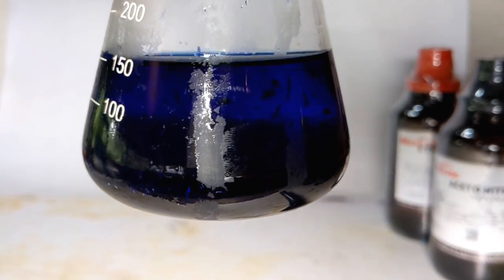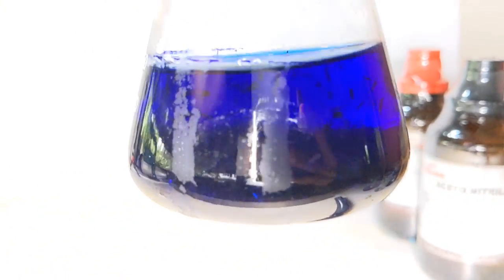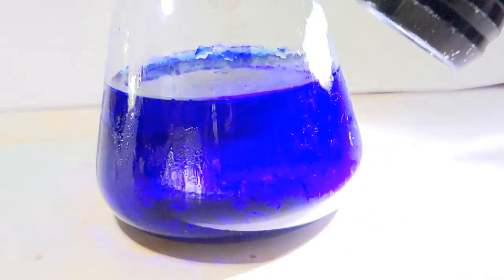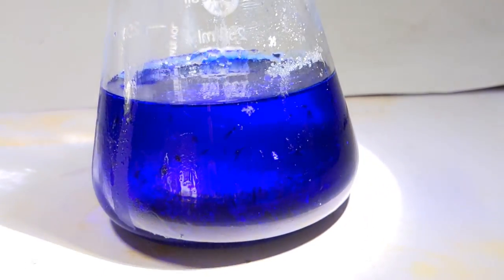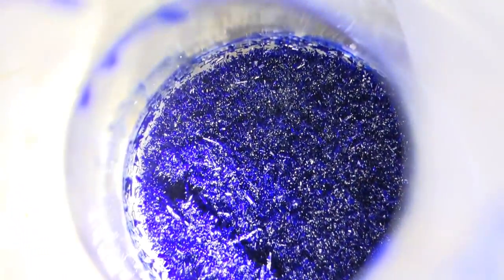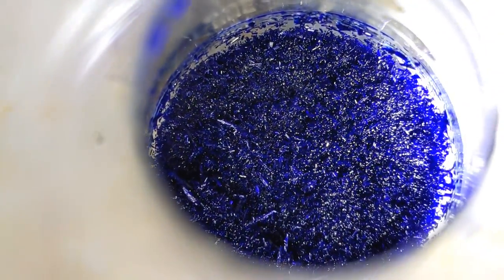The next day I got these beautiful crystals in the flask. It's very difficult to spot the deep blue crystals in the supernatant deep blue solution. Here you can see me messing around with a flashlight trying to show you guys the crystals. I have carefully decanted the solution and now you can appreciate the crystals in the flask.